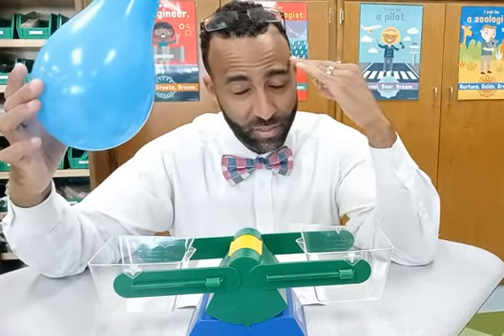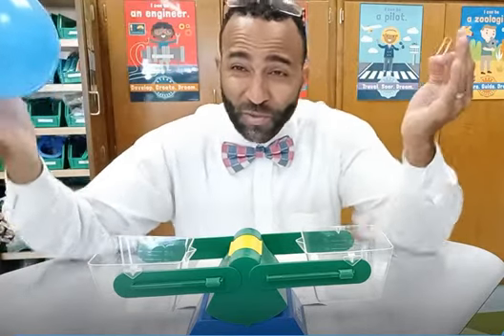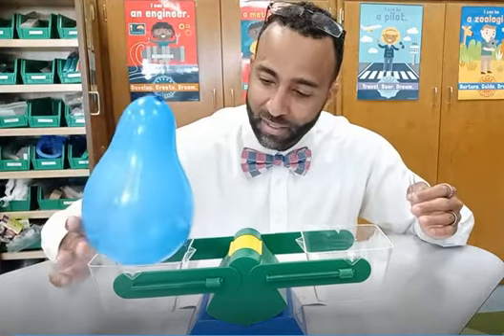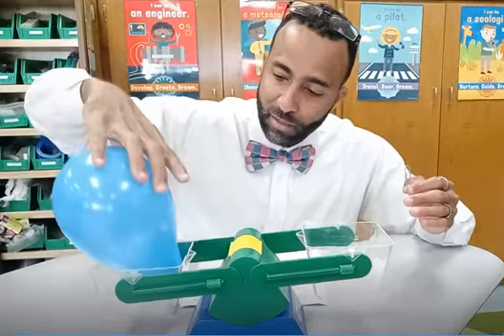Which am I going to go first with this time? The balloon. You want the balloon? Okay, here's the balloon. I'll go the balloon first. Will of the people. Can I even get the balloon in there? Let's try the skinnier end first.